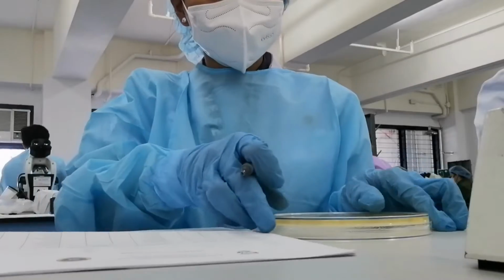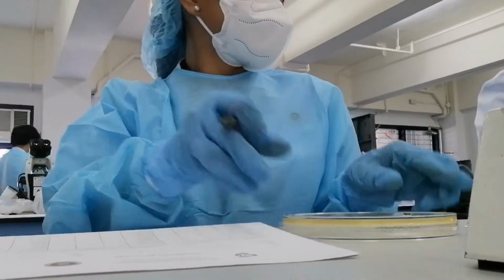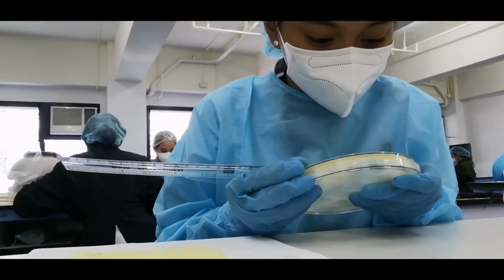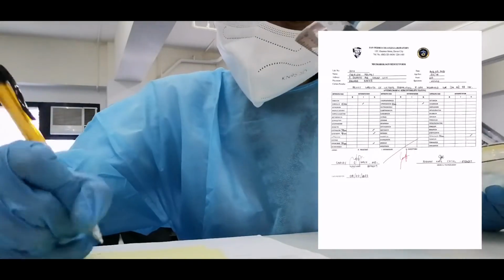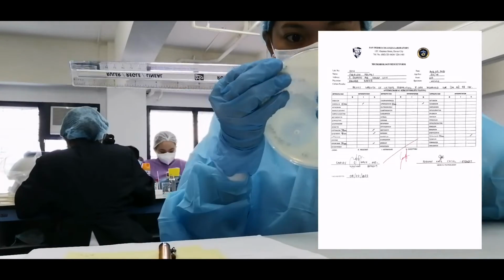After incubation, now it's time to read and interpret the zone of inhibition. To determine whether the bacteria are sensitive to the antibiotic disc you have placed on the agar, you will need to measure the zone of inhibition around the disc from the back of the plate. You can measure the zones using a ruler. The measurement should be the diameter of the zone of inhibition where no bacteria have grown, to the nearest millimeter.